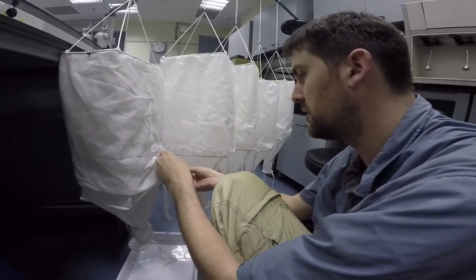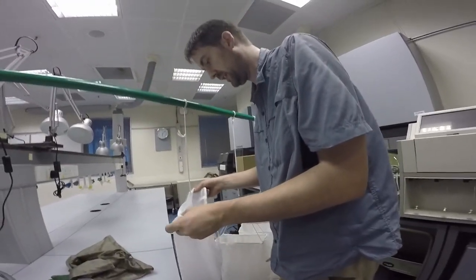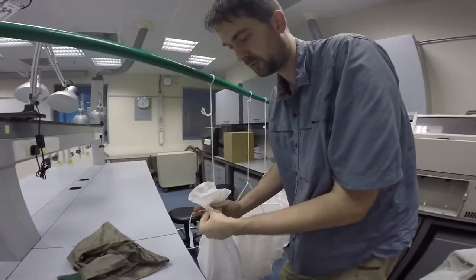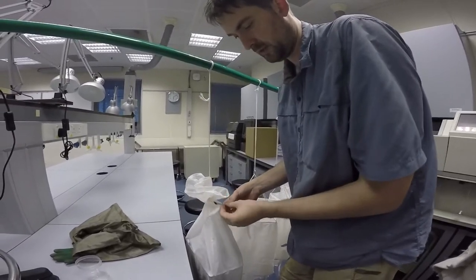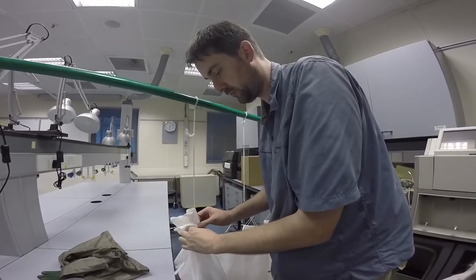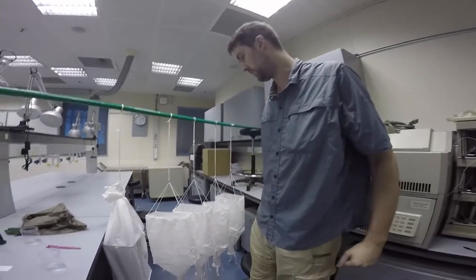Don't forget that last step — otherwise most of it would just fall off. Here we had an ant that tried to escape. We are finishing our Winkler bag — bye, we'll see it again in three days. We could actually weigh the mass of the dry leaf litter and also get an idea of the volume that we sifted within those four square meters. We close it, make it cleanly, make a tie knot to be sure that nothing else can escape — or actually go in, which is sometimes a problem in other places, since very small ants can go in and steal all the fruit of your product. So here's the Winkler bag ready, and today we're going to do probably at least 12 or 15 of them. We have a bunch of leaf litter to dry. I hope you like this video and it will be useful.